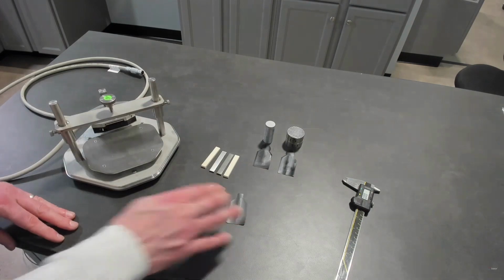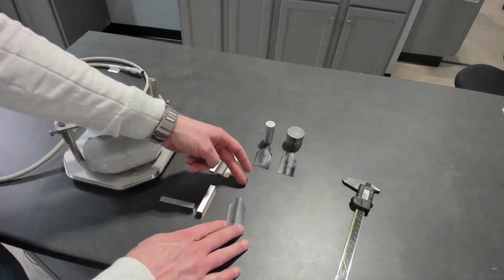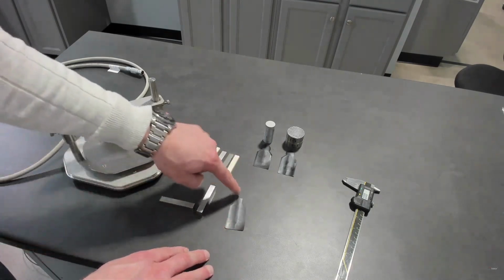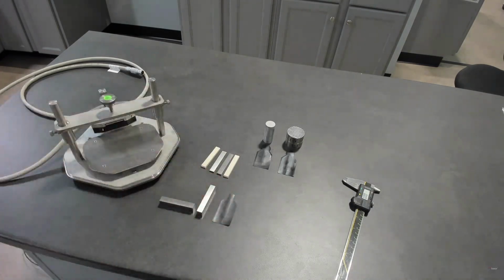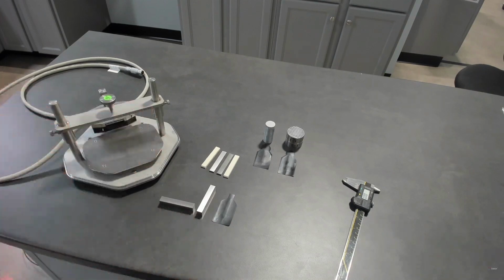So that's a little description of transient hot strip. If you want to get in contact with us and see the different dimensions of transient hot strip sensors we have, we can talk about your application. That gives you an example of why this hot strip is unique and very specific to materials of unique dimensions and size, or direction that you want to be sensitive to.